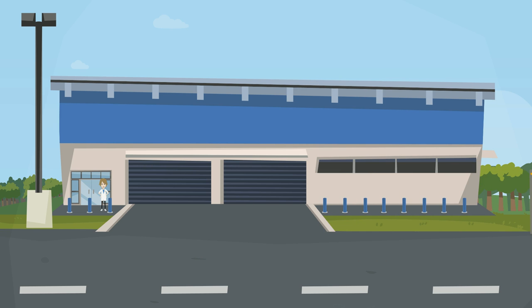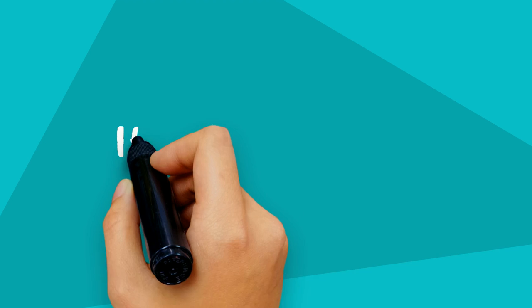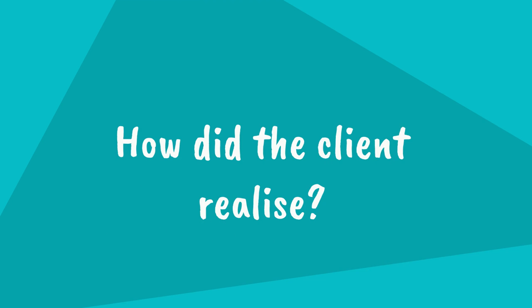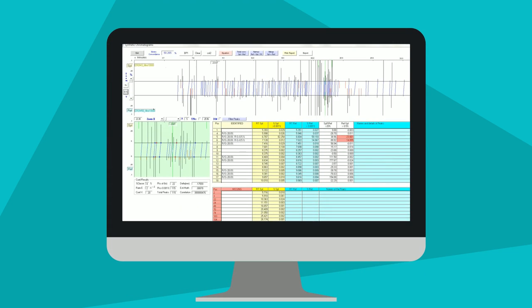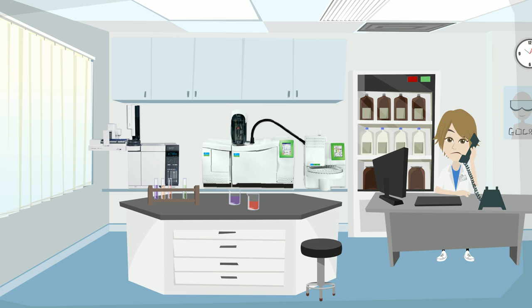Even one time, her client sent her back the order because the product did not pass their quality control. How did the client realize? Simply because they were using a software called GC-LC Concordance, which compares automatically complex chromatograms in seconds with a lot of precision. When her client told her, she immediately got GC-LC Concordance software to solve all her problems.